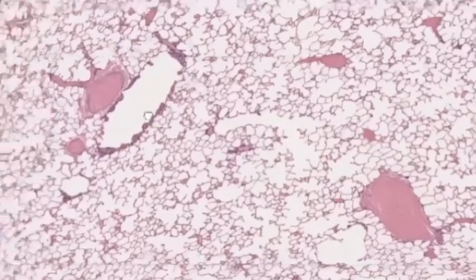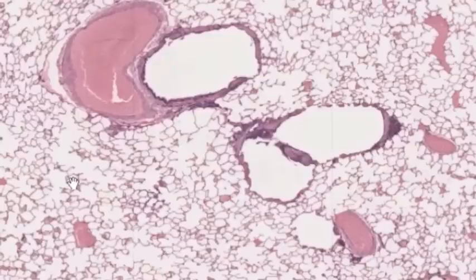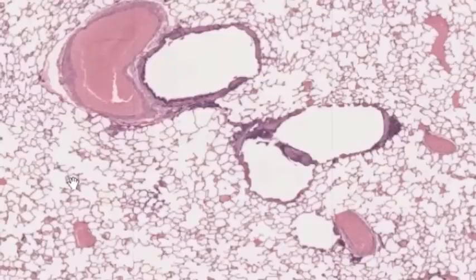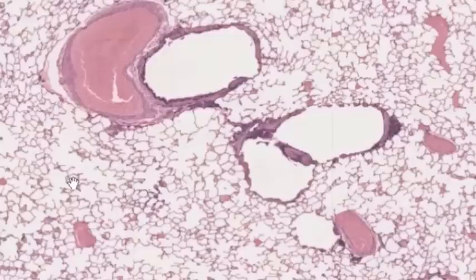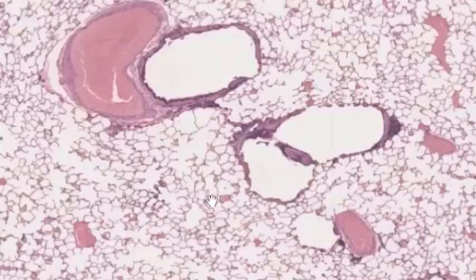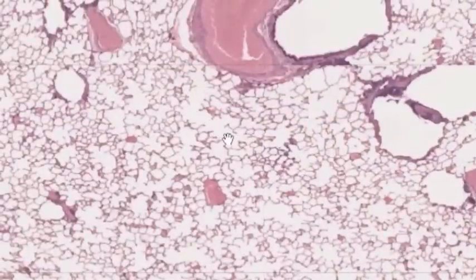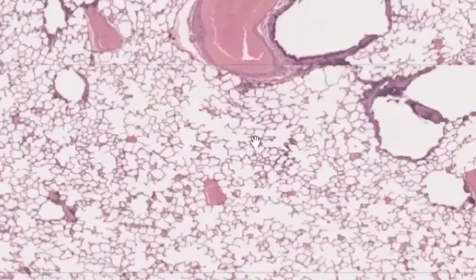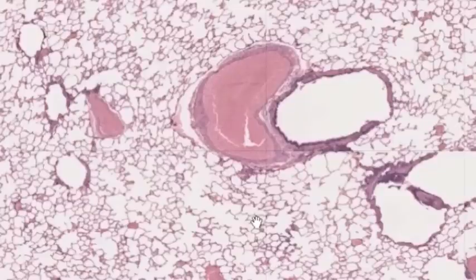To revise: if it has cartilage in its wall it's a bronchus; if it has a distinct wall with no cartilage it's a bronchiole; if the bronchiole has outpouchings forming alveoli it's a respiratory bronchiole. Below the level of the respiratory bronchiole, the structures are alveolar ducts and the individual alveolar sacs. Within the alveoli we can see type 1 pneumocytes, type 2 pneumocytes, and free alveolar macrophages.